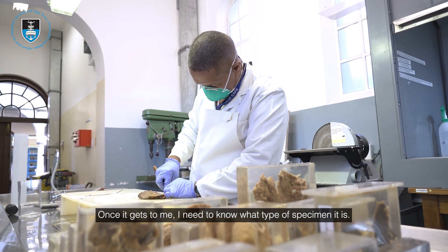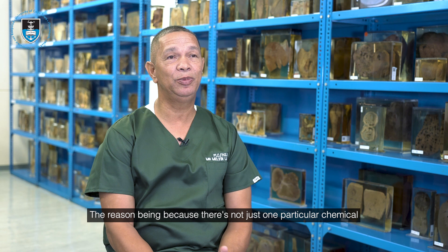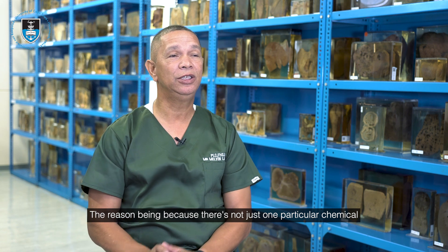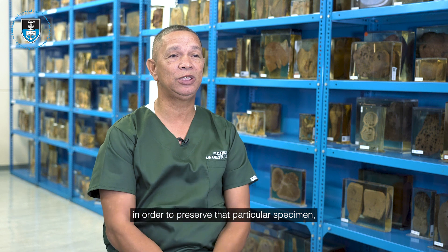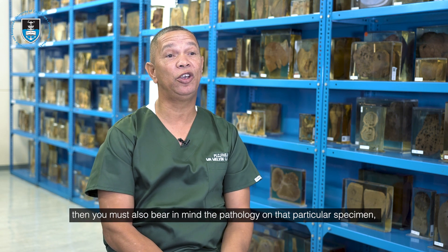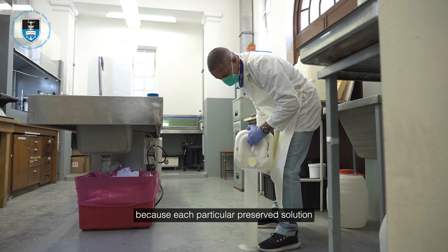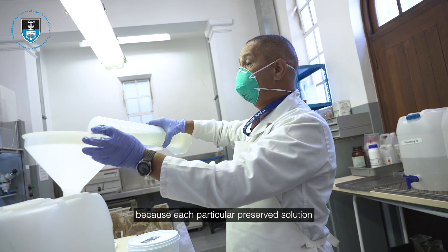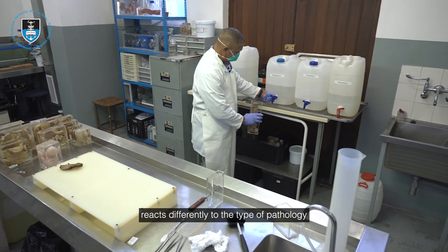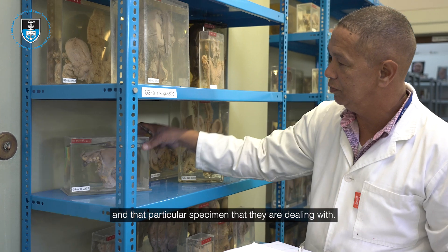Once a specimen gets to me, I need to know what type of specimen it is, because there's not just one particular chemical used to preserve it. You must also bear in mind the pathology on that specimen, because each preservation solution reacts differently to the type of pathology on the specimen you are dealing with.